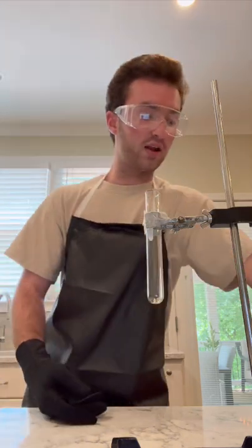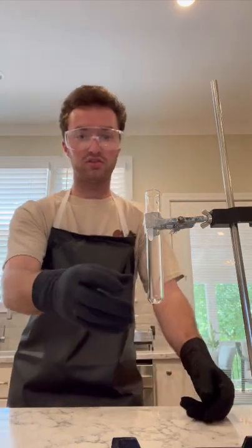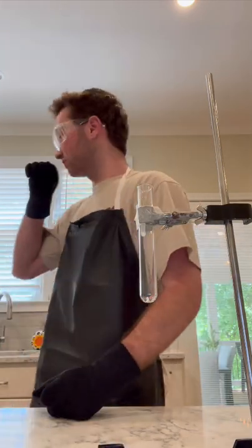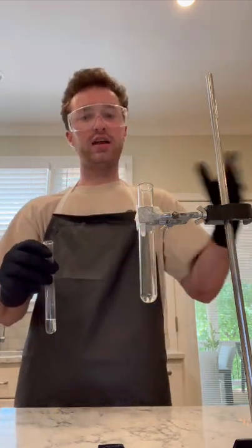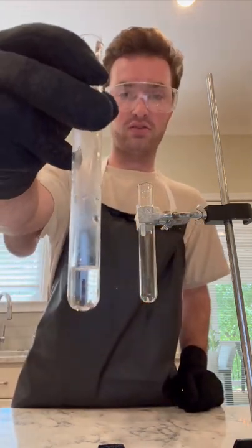I crumbled it up, and then I placed it in this test tube here, which is on a metal rod. I'm not really sure if you can tell in the video, but there is a crumbled up piece of aluminum foil on the bottom there. And then from there, I did the HCl, not the same HCl, but the HCl that I already prepared. I got 2 more milliliters from that, just poured into the test tube.